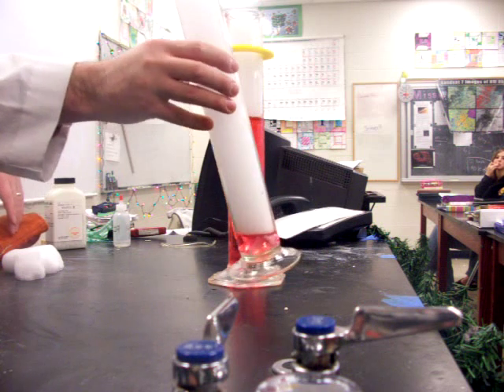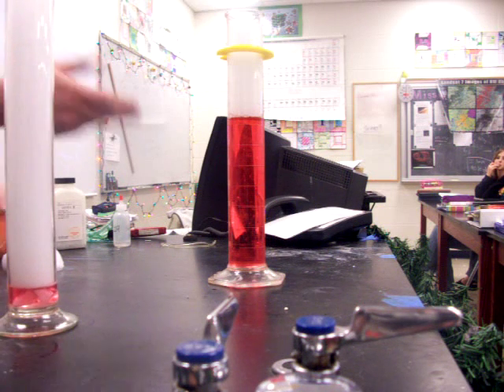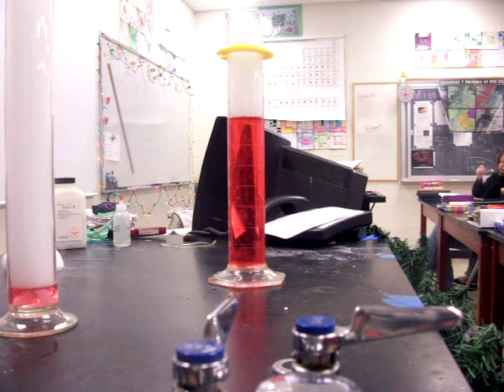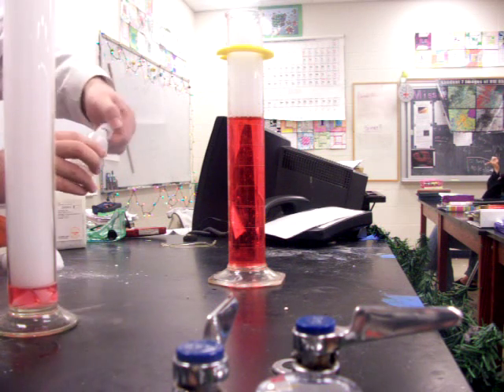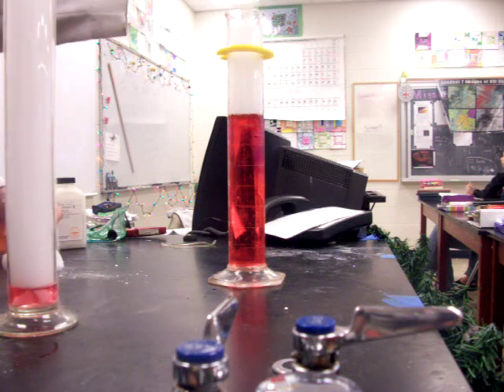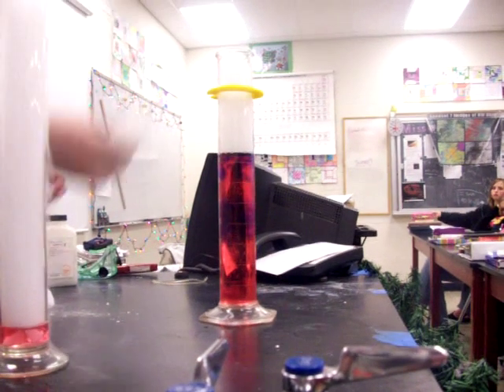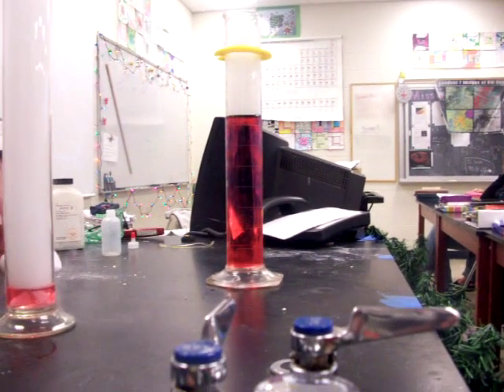But the dry ice has stayed in my other graduated cylinder, the original one. So now what we can do is add some base and try to get it to go back into the basic range of pH.